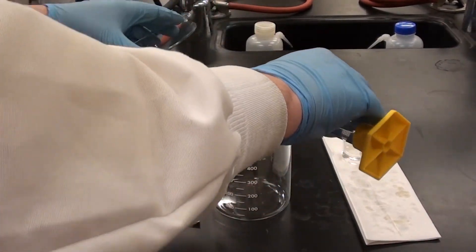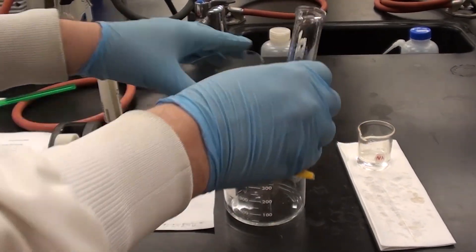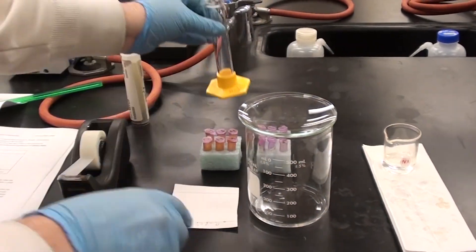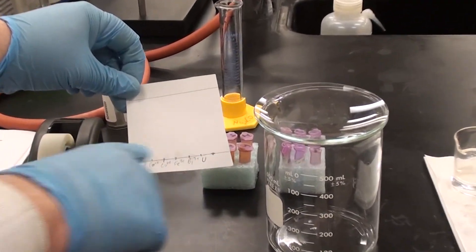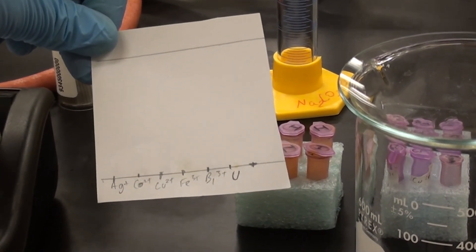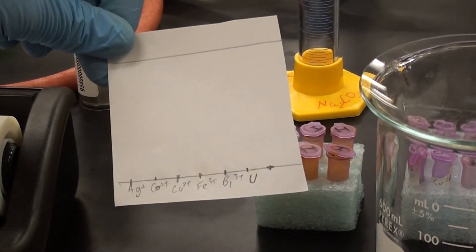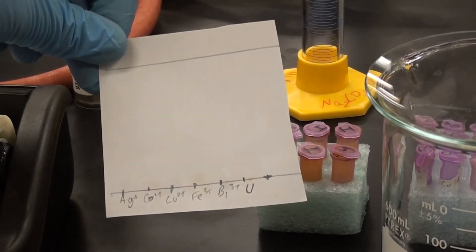It's really important that the level of this solution stays below this line right here where the ions are all placed. Otherwise, what will happen is the eluting solution will wash the ions off and you won't get a good result.